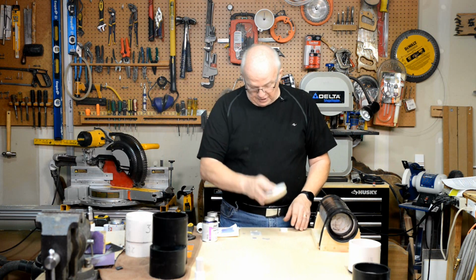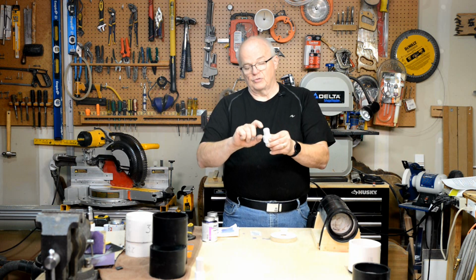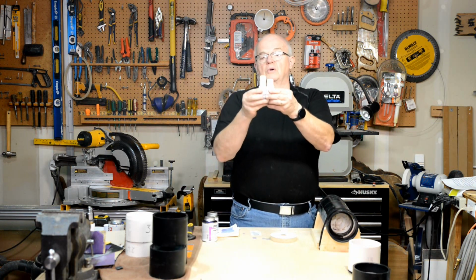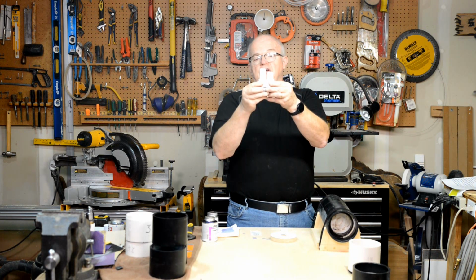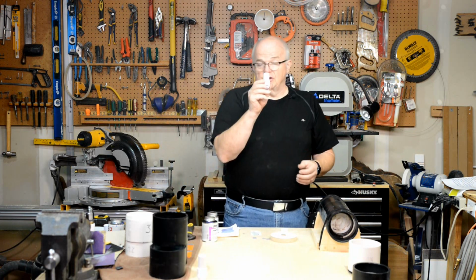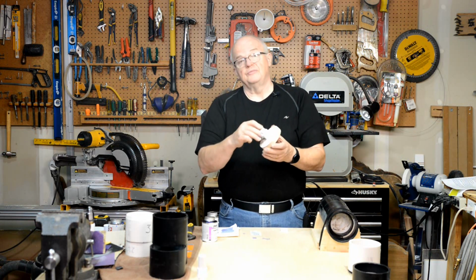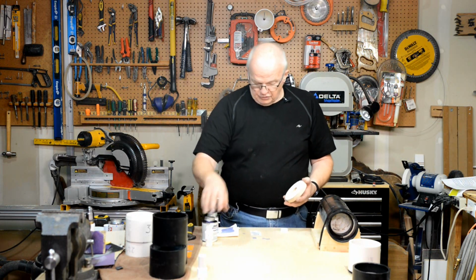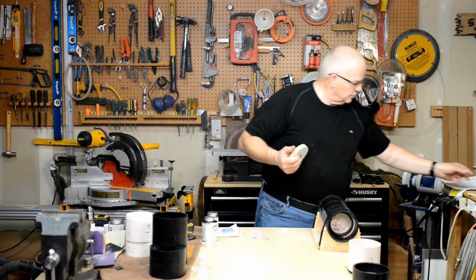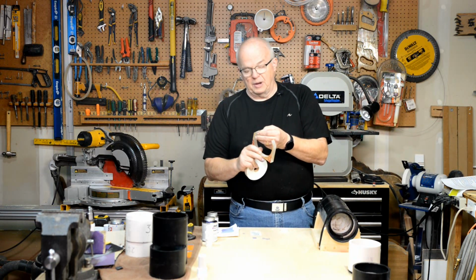So you'll take your acrylic, you'll take the short adapter. This is the one that's short. This is the one that was 2 1/4 inches instead of 3. You'll notice this is the long one. This will go in that other end cap. But anyhow, you'll take this and you'll take this, and we're going to want to seal that into there. Now, the first thing I want you to do, though, is this should still have the paper on it. If you've got your acrylic, you can see right here, this is a scrap piece, but it'll still have the paper on it.